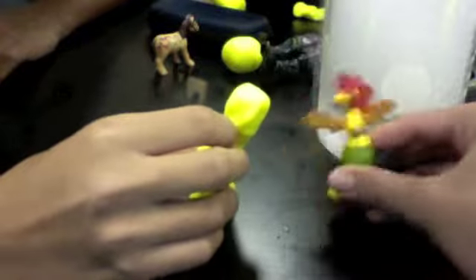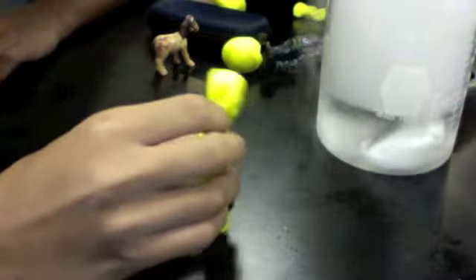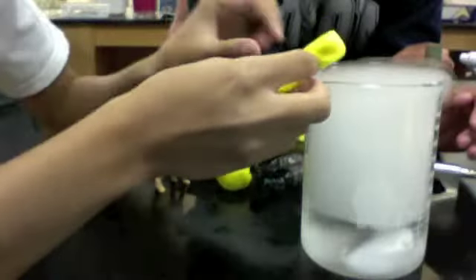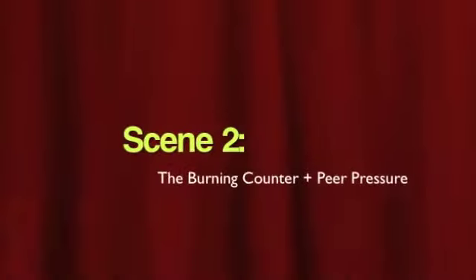What is going on in this picture is that gas is dripping directly from the beaker. This is a process called sublimation. Sublimation is where a solid, such as dry ice, is converted directly to a gas, as you see dripping out of the beaker. Remember to always use safety gloves when handling dry ice, and listen to your instructor.